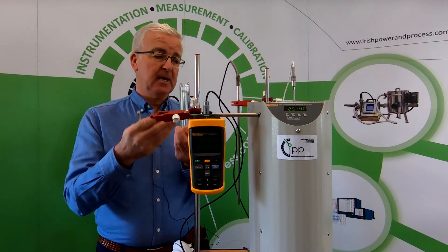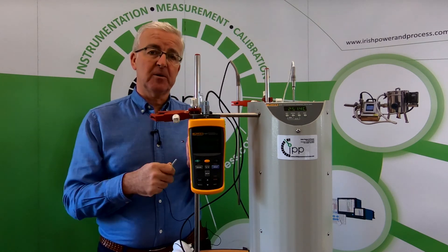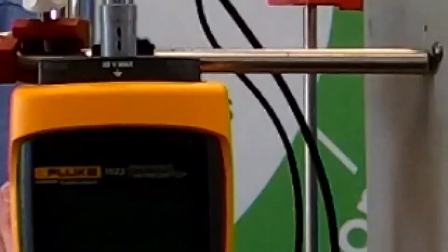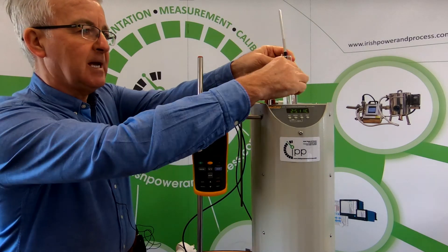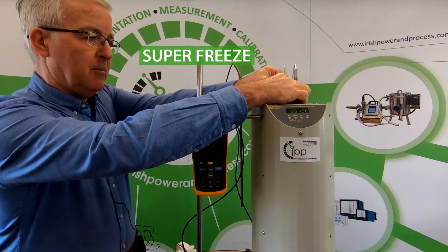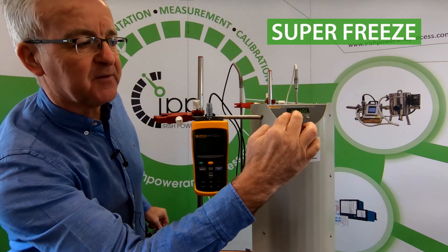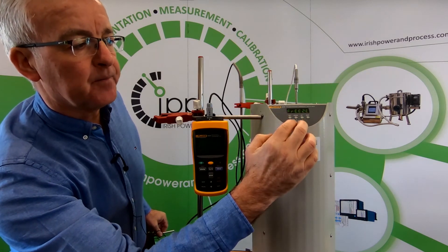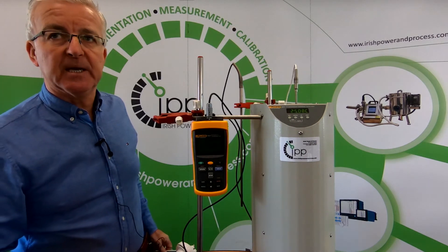We check that the resistance at the triple point of water is still the same, confirming the thermometer is good to use. We put the cell into our maintenance apparatus, lower it down, and set it off to super freeze using the advanced features. Then we wait 20 minutes.